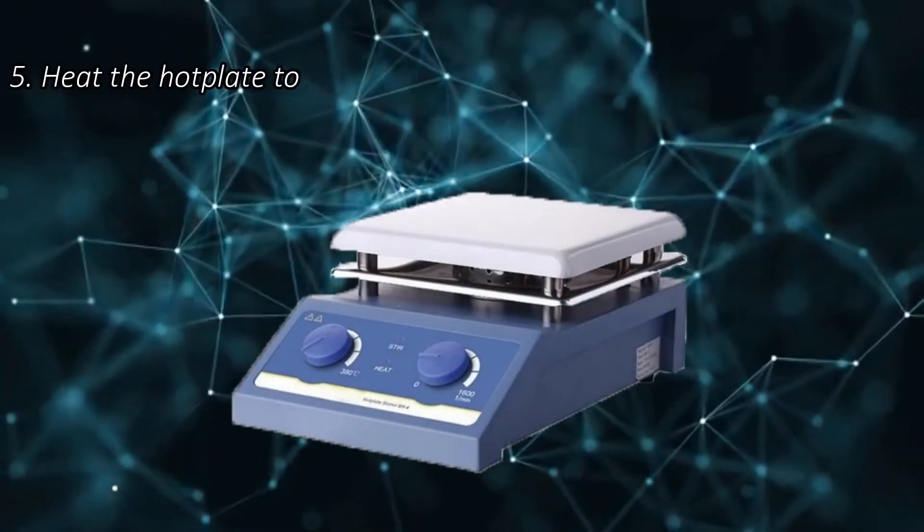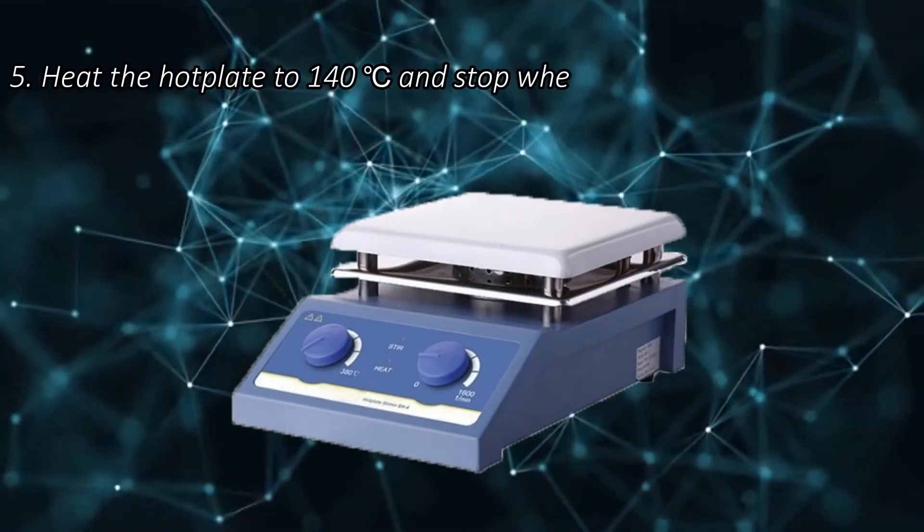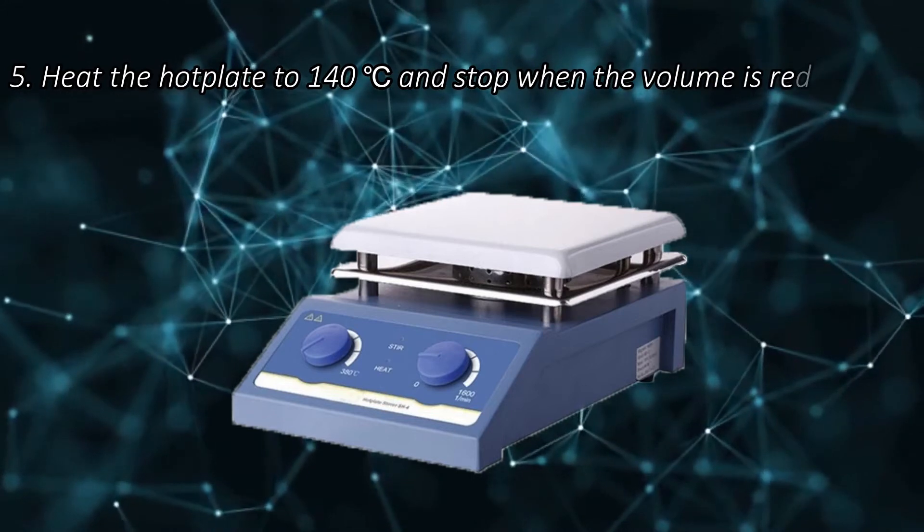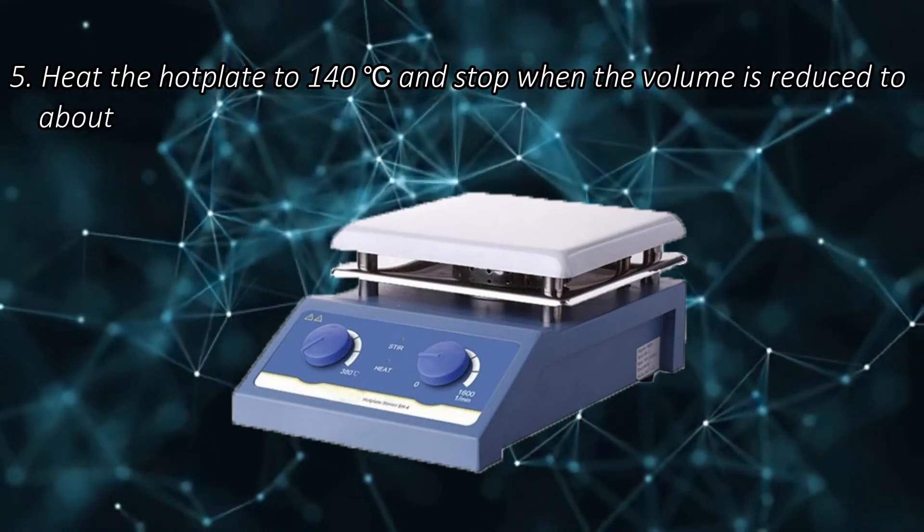Step 5. Heat the hot plate to 140 degrees Celsius and stop when the volume is reduced to about 0.5 ml.